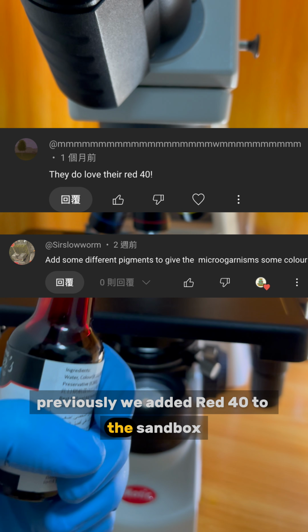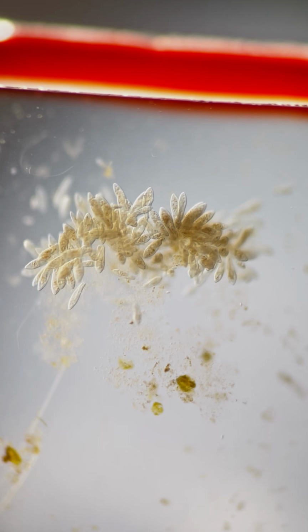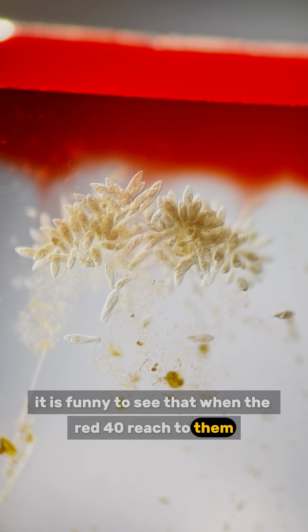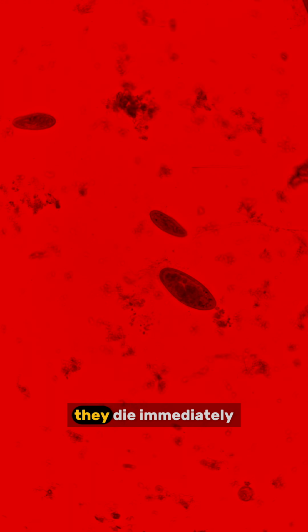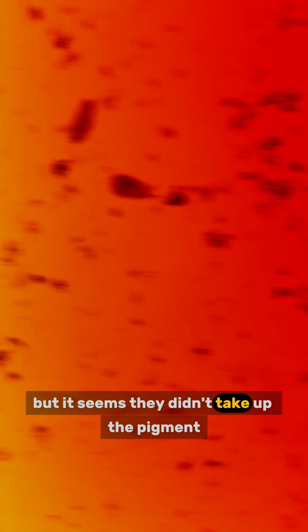Previously, we added red 40 to the sandbox. Now we try to add it on the slide. It is funny to see that when the red 40 reached them, they immediately spread away. It seems they are scared of it. When they are immersed in the dye, they die immediately. But it seems they didn't take up the pigment.